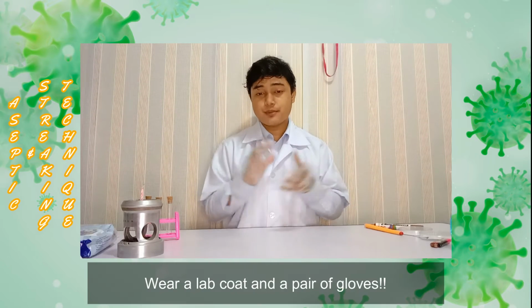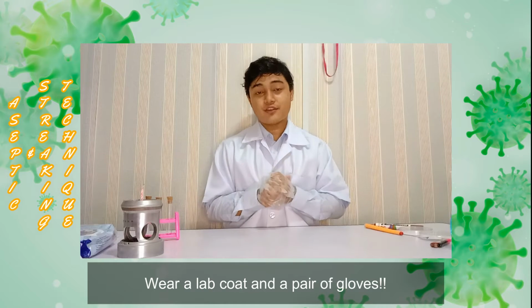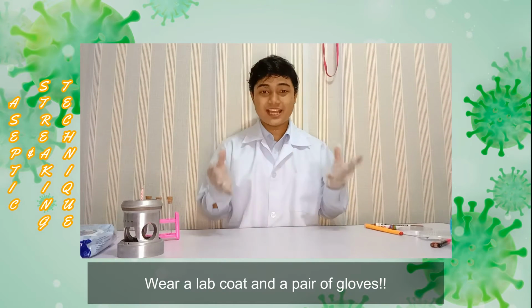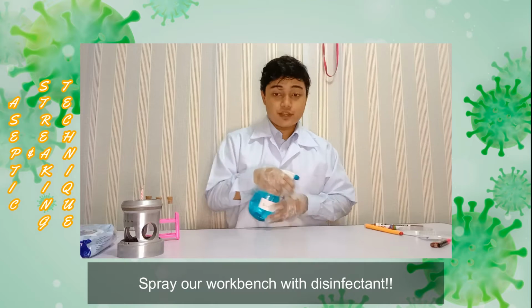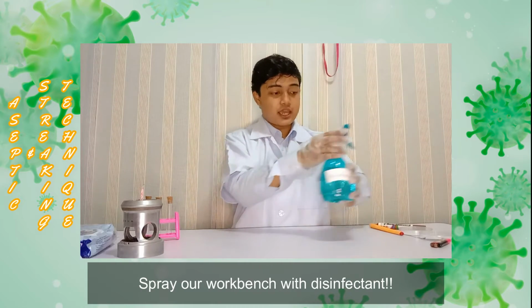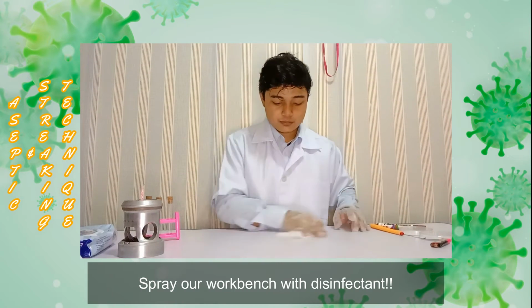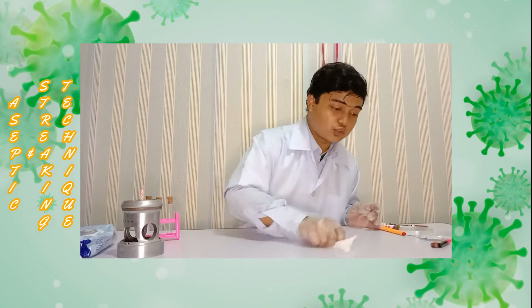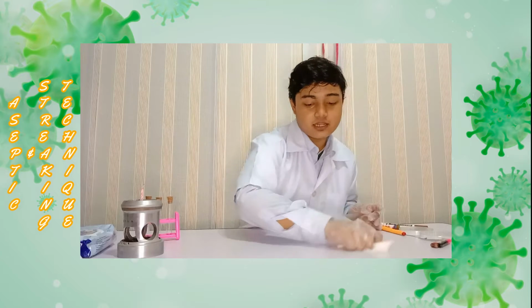There are a few precautions when we want to start our experiment. First, we need to remember to wear a lab coat and a pair of gloves to prevent infection by microorganisms and to avoid contamination of our workbench. We also need to spray disinfectant on our workbench and use a white tissue, to make sure there is no dust and no contamination on our table.